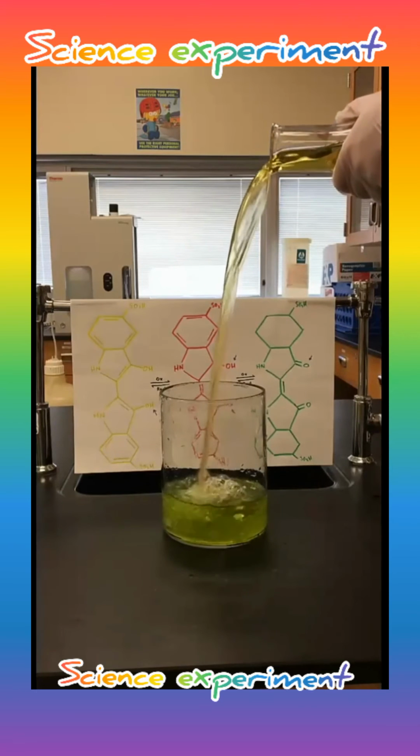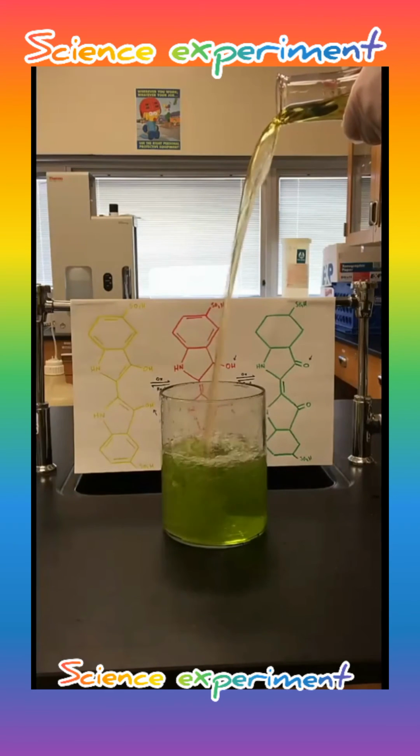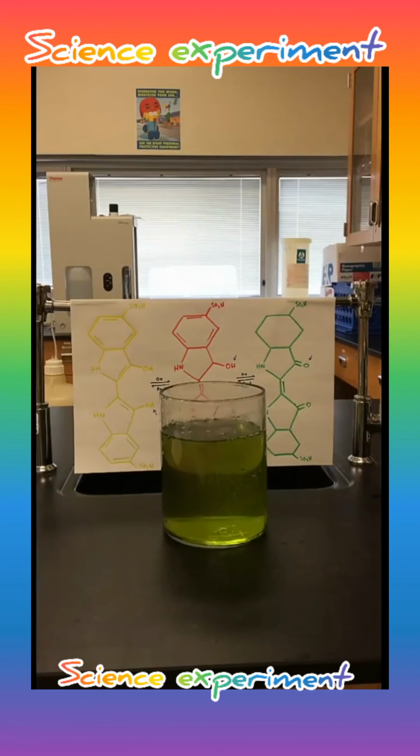Here we are pouring it out. You see the yellow in the flask and the green in the large beaker. But once we stop adding oxygen, it goes right back to red and then to yellow.